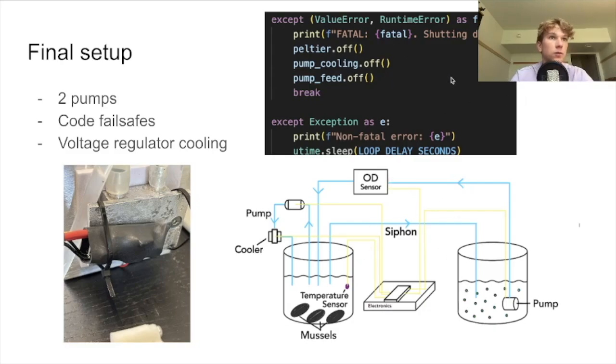We've added code fail-safes. If a sensor fails or a value goes off, the system shuts down the peltier and both pumps to prevent overcooling or overfeeding. We also cool the voltage regulator by zip tying it to the peltier. While this slightly reduces cooling efficiency, it improves overall safety and reliability.